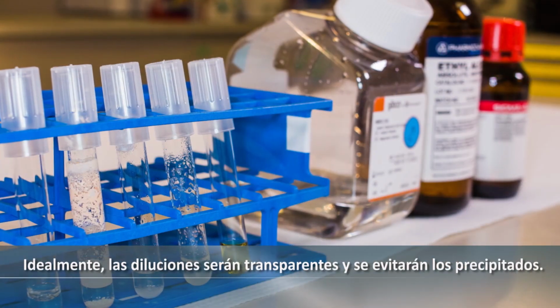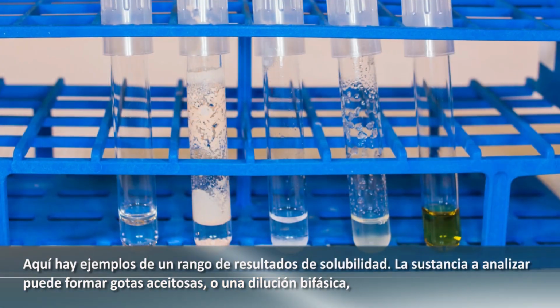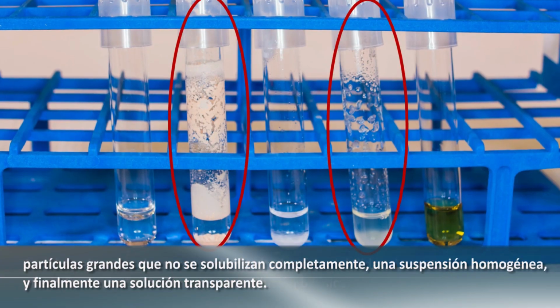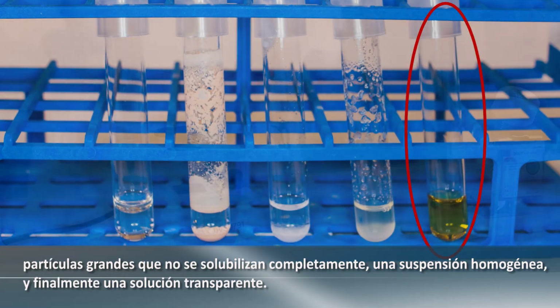A solubility assessment is performed to determine the appropriate solvent to use in preparing the dilutions of test substances. Ideally, the dilutions will be clear and precipitates avoided. Here are examples of a range of solubility results. The test substances may form oily droplets or a biphasic dilution, large particles that do not fully solubilize, a homogeneous suspension, and finally a clear solution.